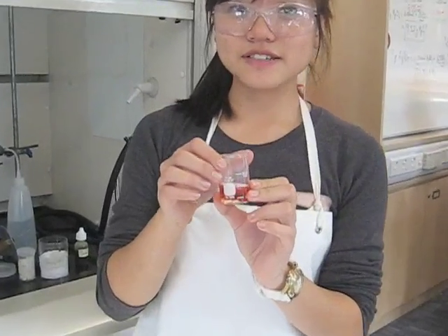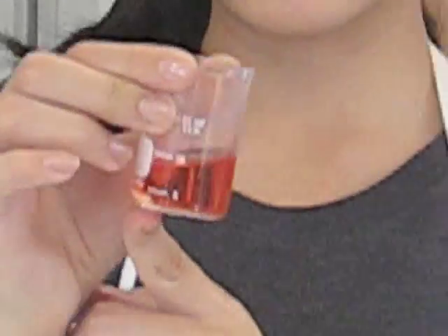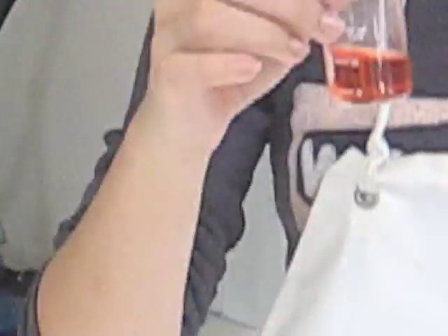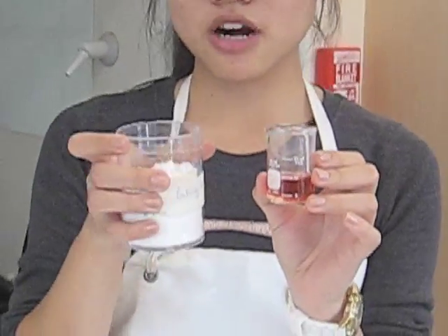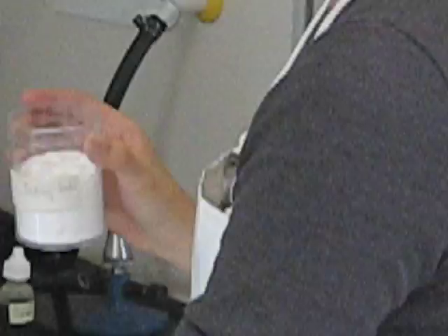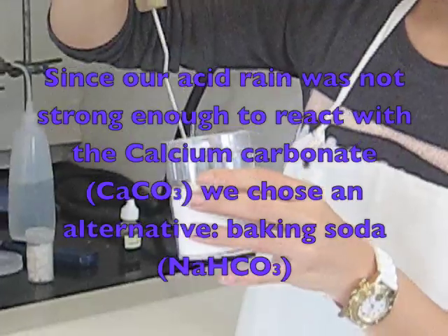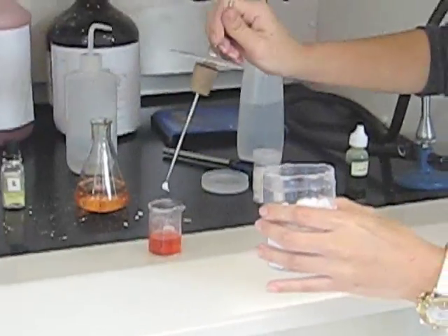Okay, something is happening. Because the acid rain that we made is not strong enough to dissolve limestone — dissolving limestone takes a long period of time. So an alternative for calcium carbonate would be baking soda, which is sodium hydrogen carbonate. So we're taking a small amount and we're just going to put it into our liquid.